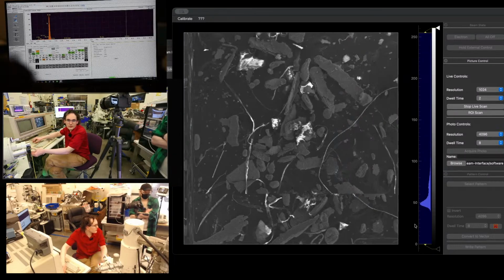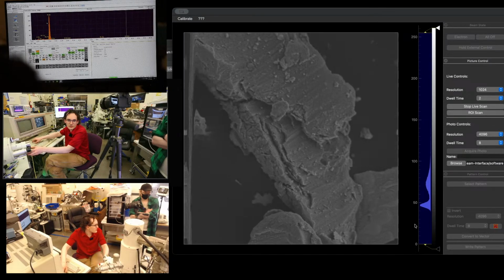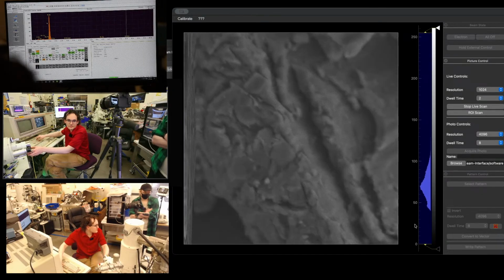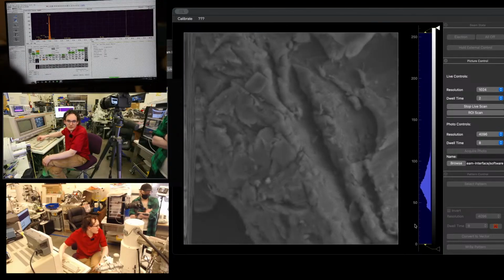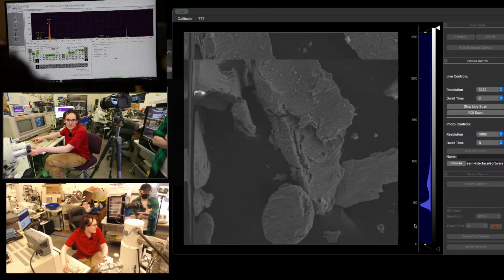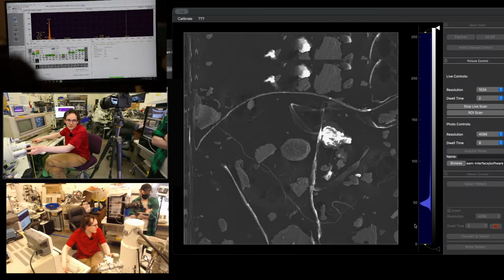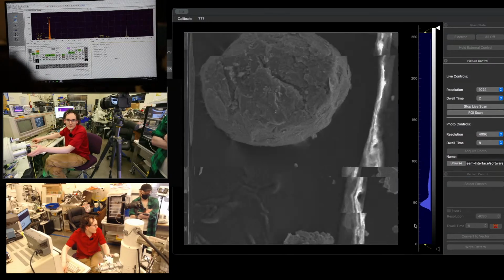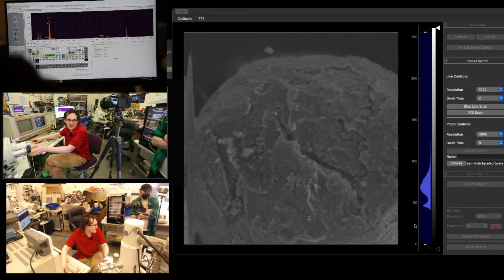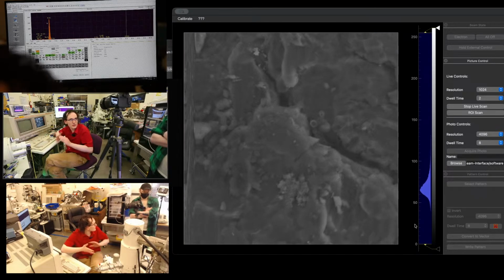A lot of really small debris, a lot of fractured edges. So I'm pretty sure the VAT valve is not aluminum. We can find out, but because of the magnetic shielding requirements, I think that we got a turbo pump rotor is what we're looking at. And also all of these round things, that's another thing that happens when you get a high speed impact, is you get a lot of stuff that rubs against each other and kind of rounds out.